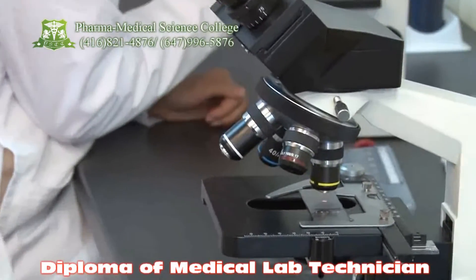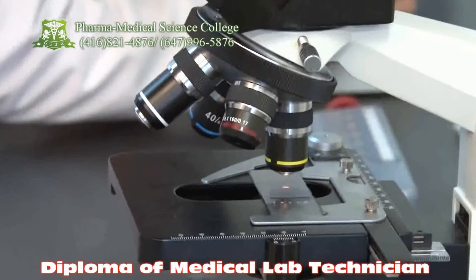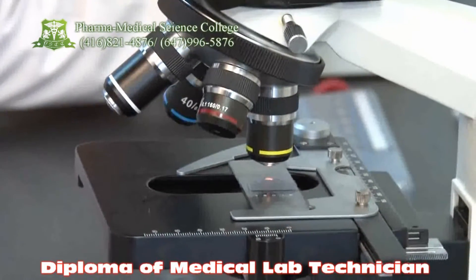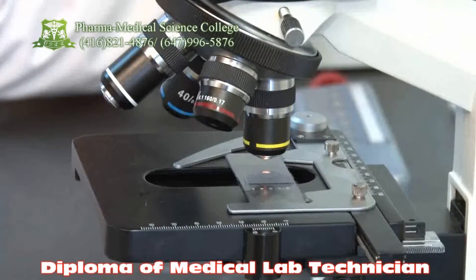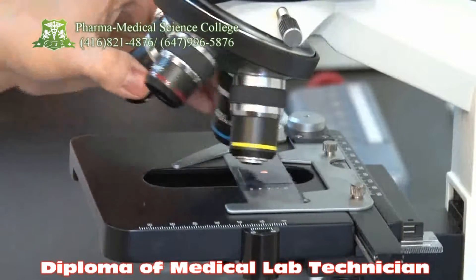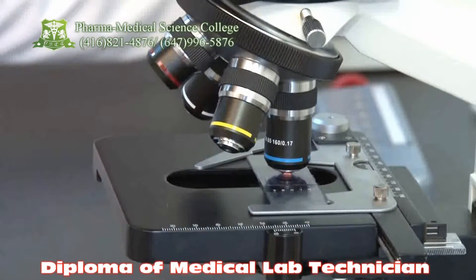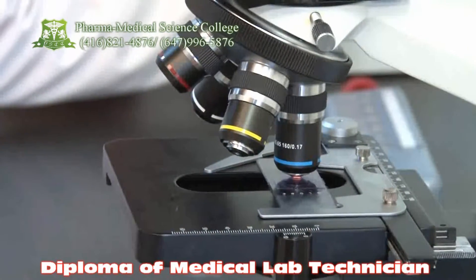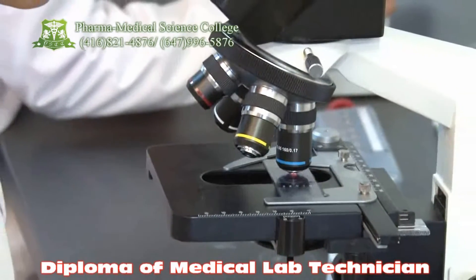Can you focus it now please? Once the focusing is done, change the objective to 40x. Now this is going to be your high objective — you will be able to see the object, the cell, and the details of the cell in a magnified manner.